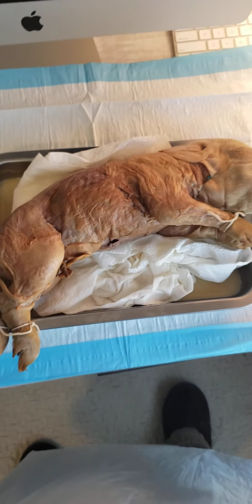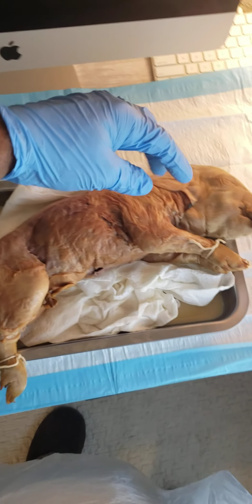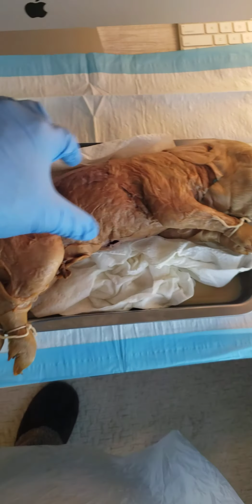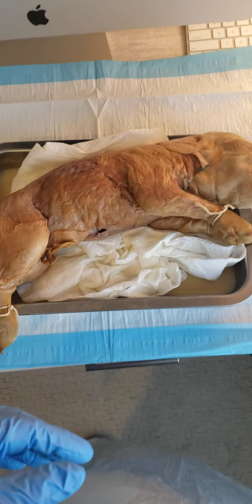Working on the next part, the axial skeleton. Let me zoom out back here. The axial skeleton of the pig is going to consist of the head, right? The head and the trunk. So the trunk of the pig, that's going to be the axial skeleton.